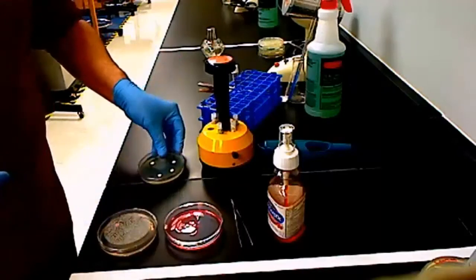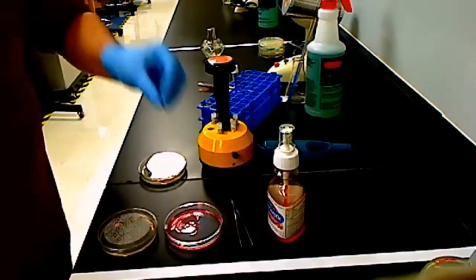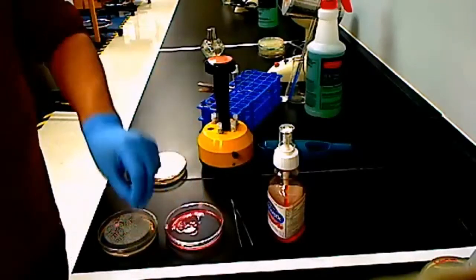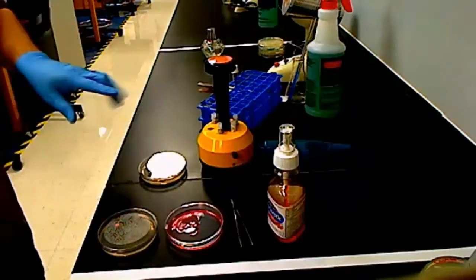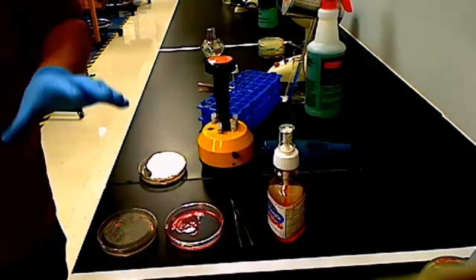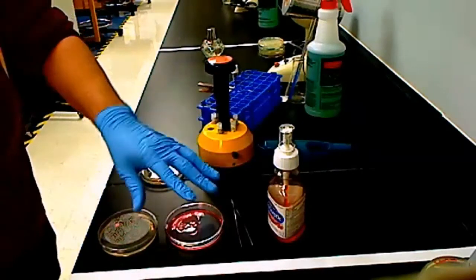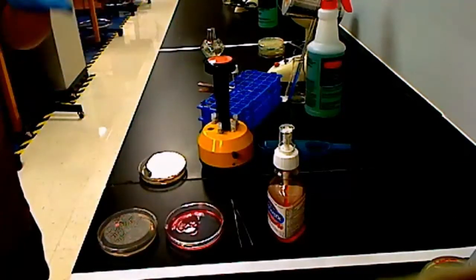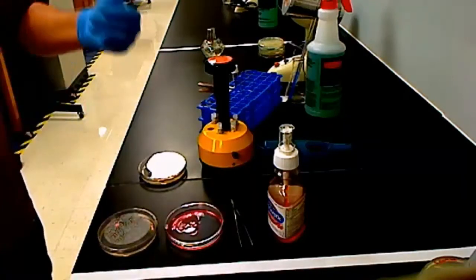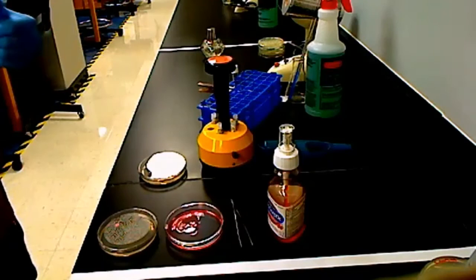The disinfectants will take a little bit longer to actually do because you have to put each disc, you have to get it out of the actual active ingredient and then put it in the appropriate quadrant. Okay, and once again, make sure you don't cross-contaminate. Anytime you take your Petri dishes anywhere, any of these stations, as I said, these 2 things, the disinfectants and the antibiotics, are going to be at different stations. You need to make sure you disinfect before you bring your plates there, disinfect after you leave that station. Okay? And remember, there's only 1 person per station.